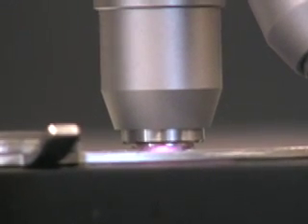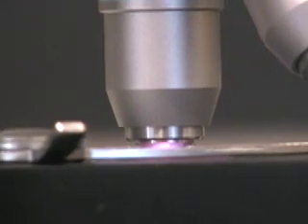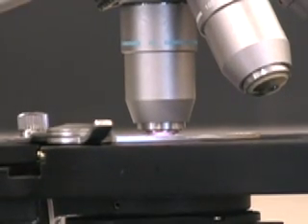Under 40X, you'll use your fine adjustment to focus until your image is clear.